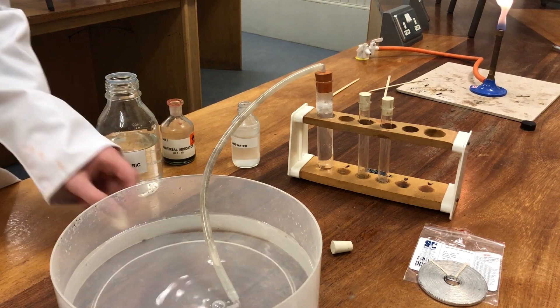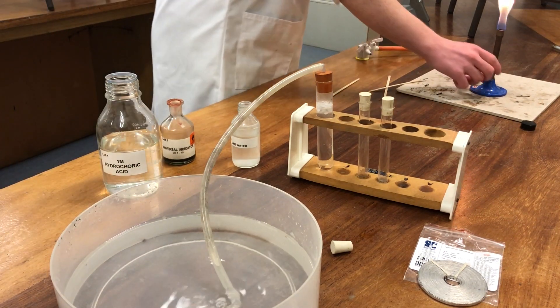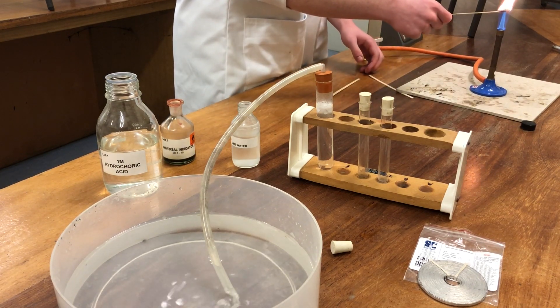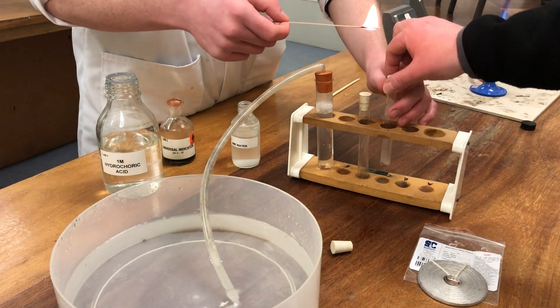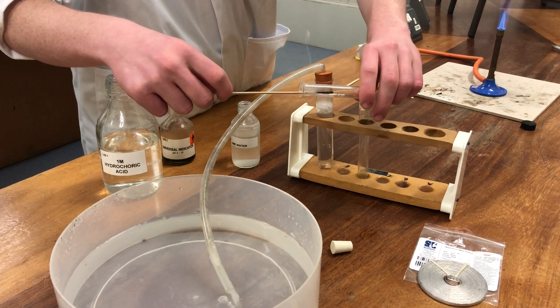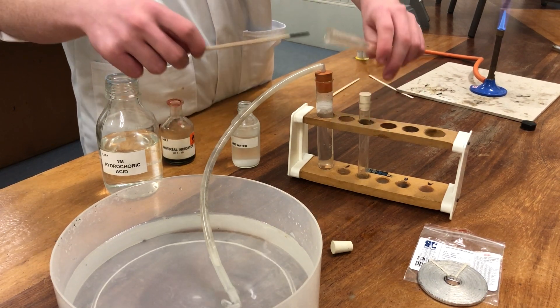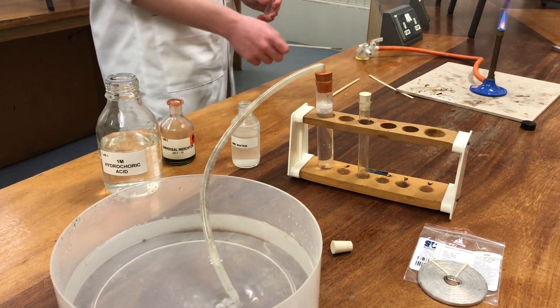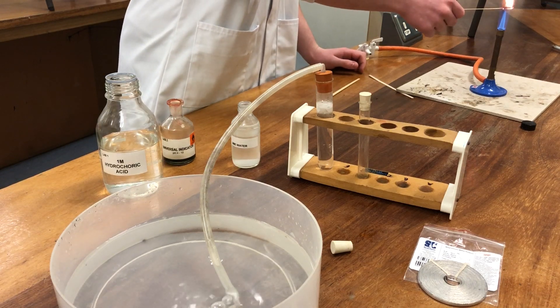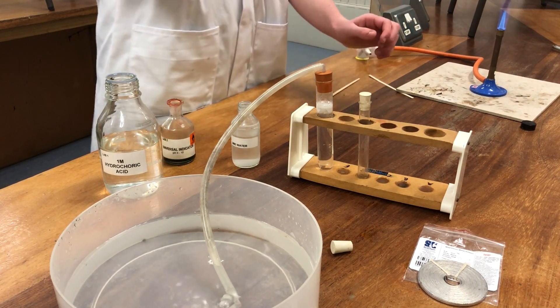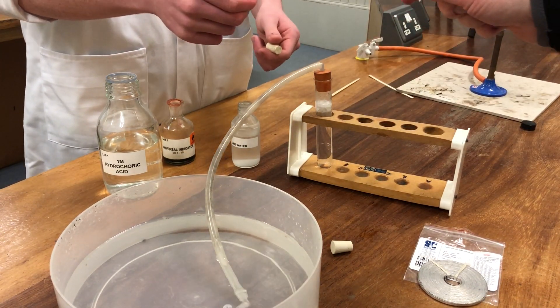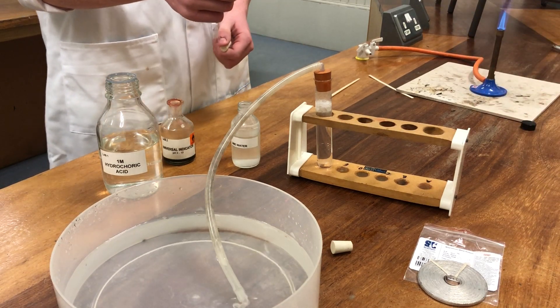The next test will be the burning splint test. Hydrogen burns with a squeaky pop.